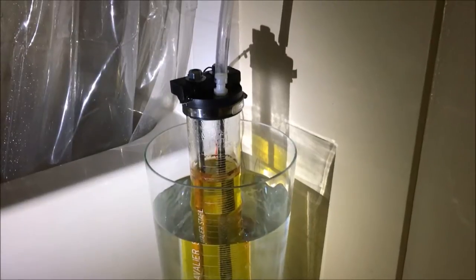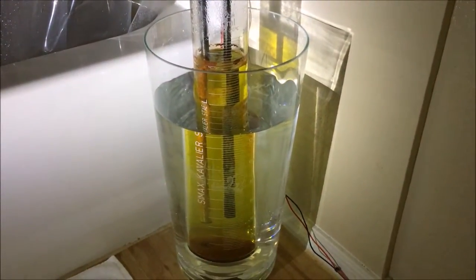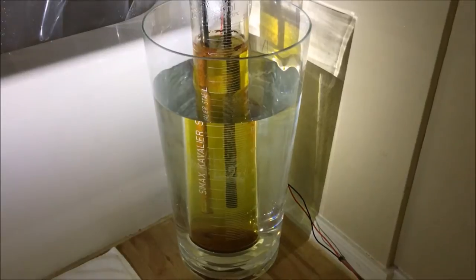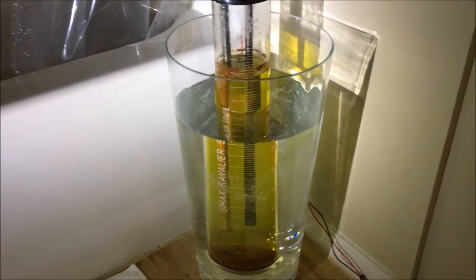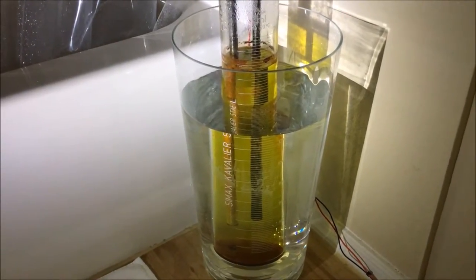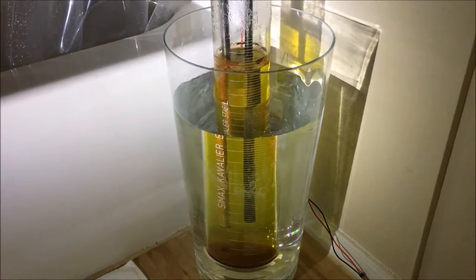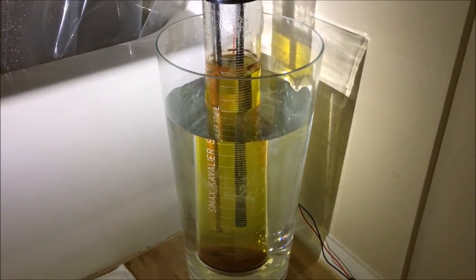I was generating a lot of water vapor, so I added this condensation vapor capture tube to this, and that worked really well. However, after I left the solution over the weekend, the coolant bath level went down considerably, and I suspect that the system overheated and resulted in the destruction of the positive anode plate of stainless steel.